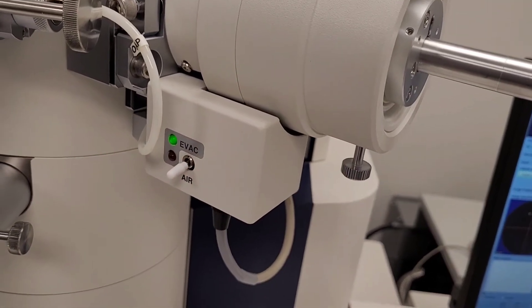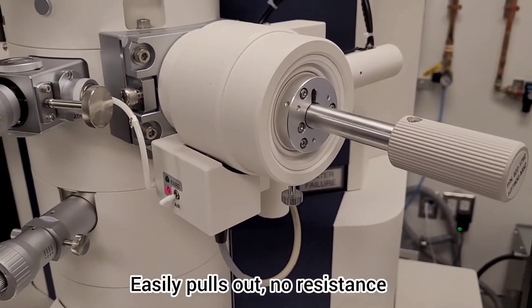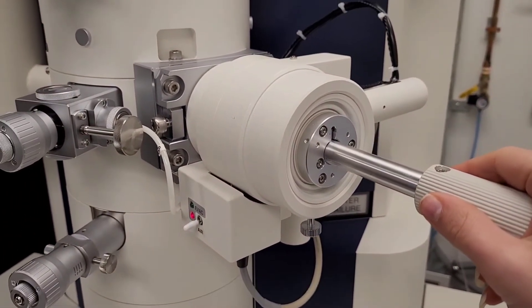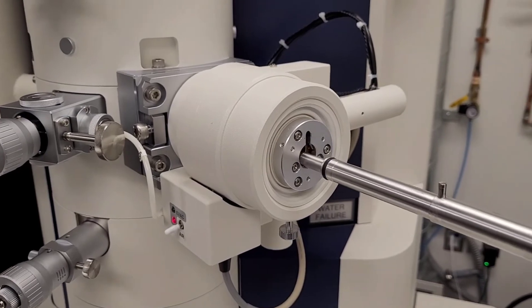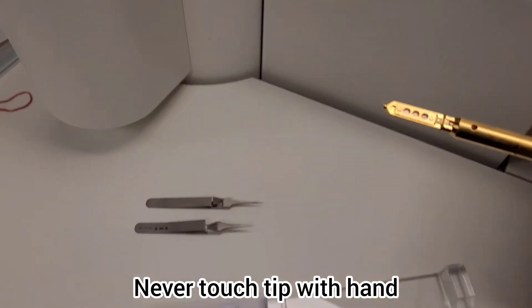Once it's done the light will turn red and you can easily pull out the probe. Remember to never touch the tip of the probe.